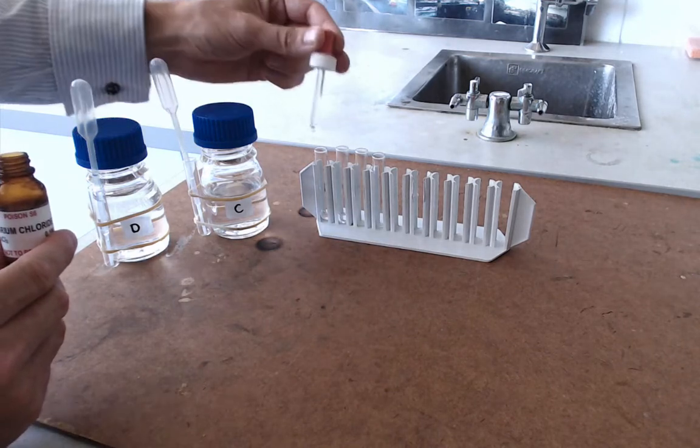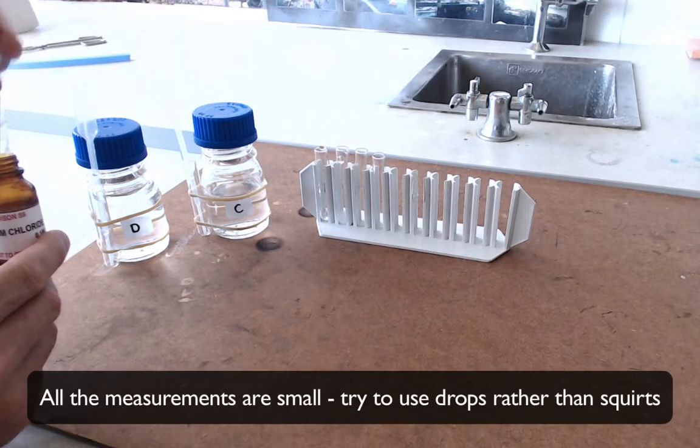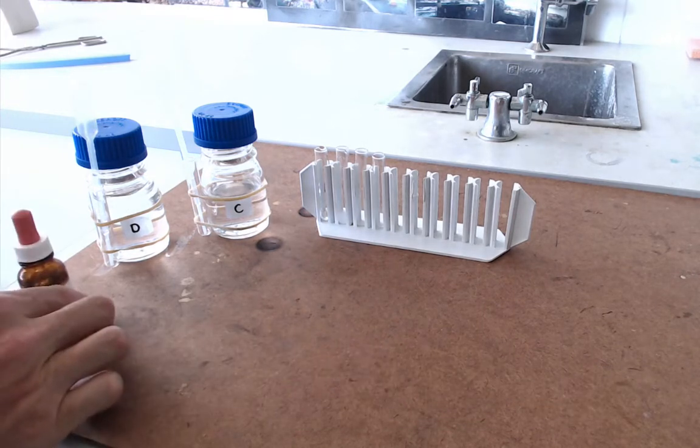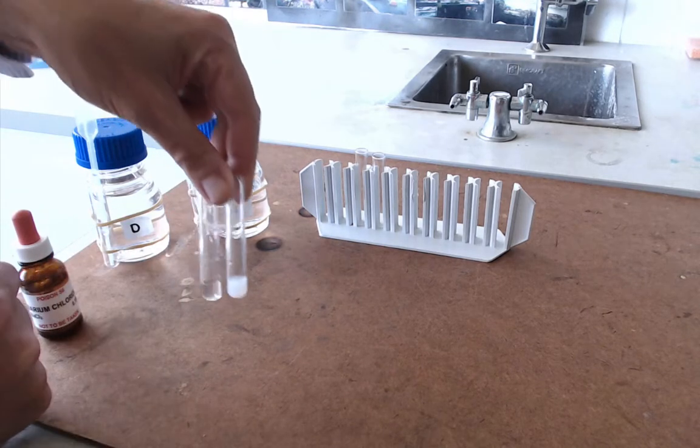So take our dropper, a few drops in there, a few drops in there, and then we observe the results of our two tests. And hopefully what you can see here is very different results in those two test tubes.